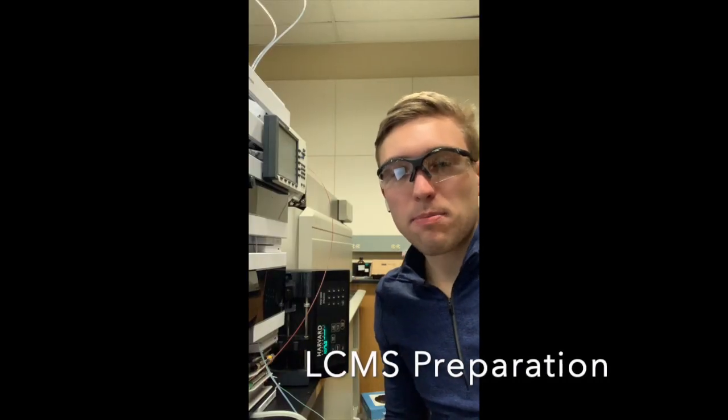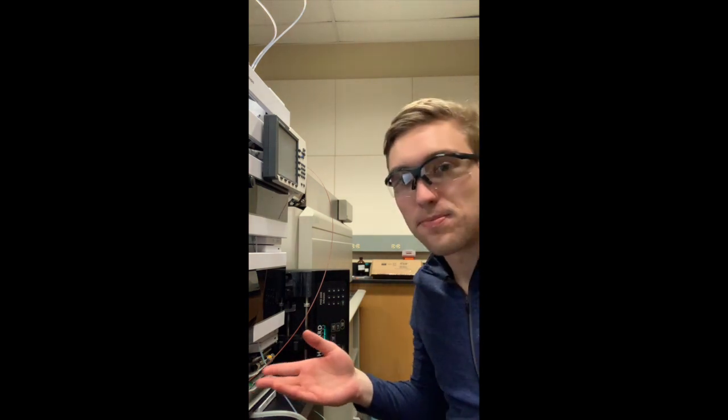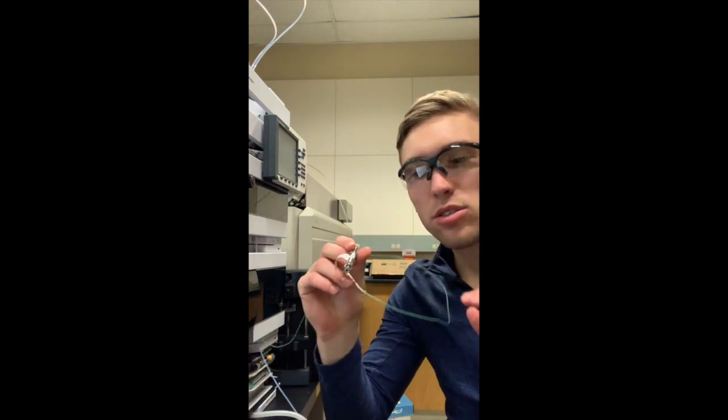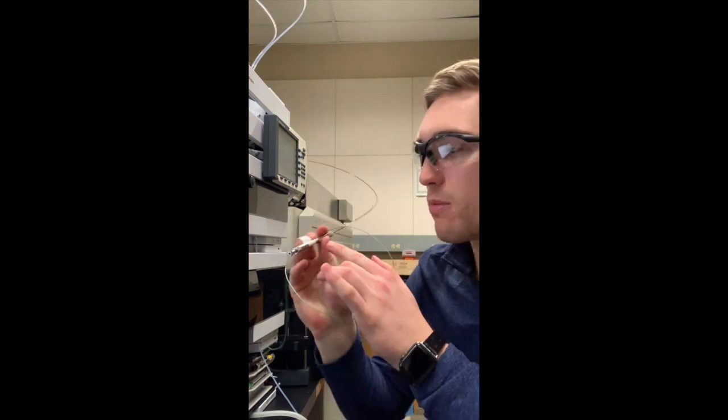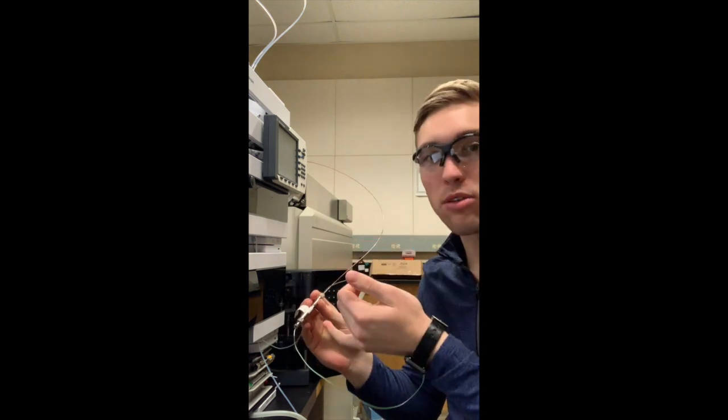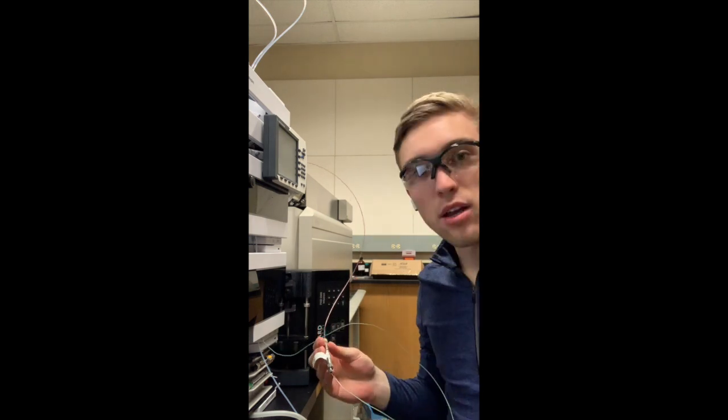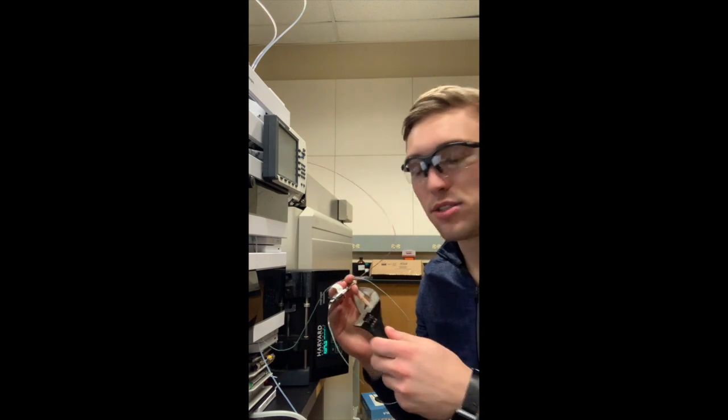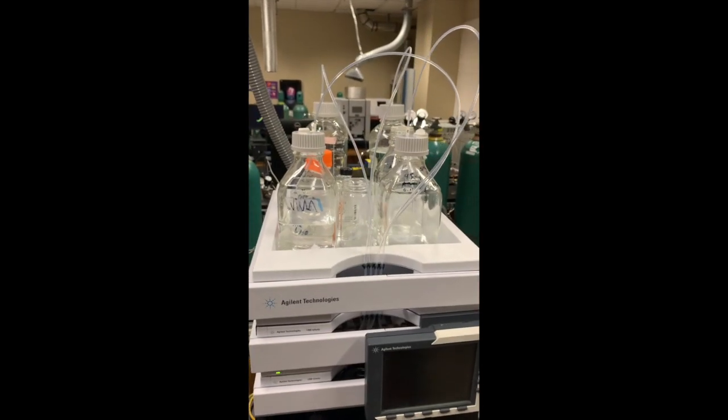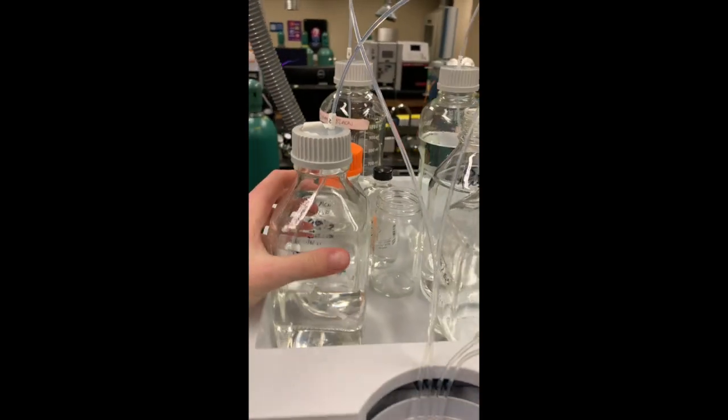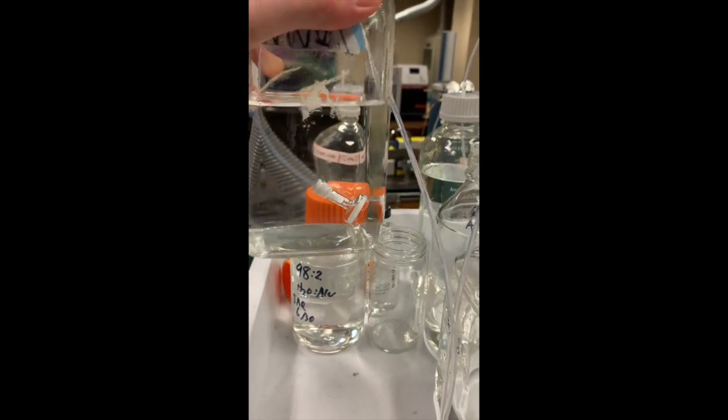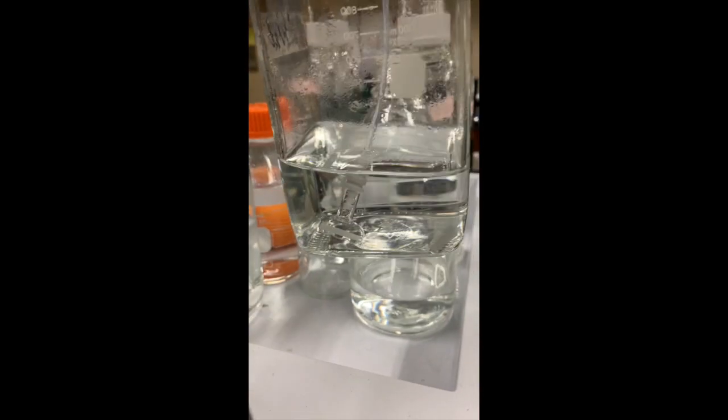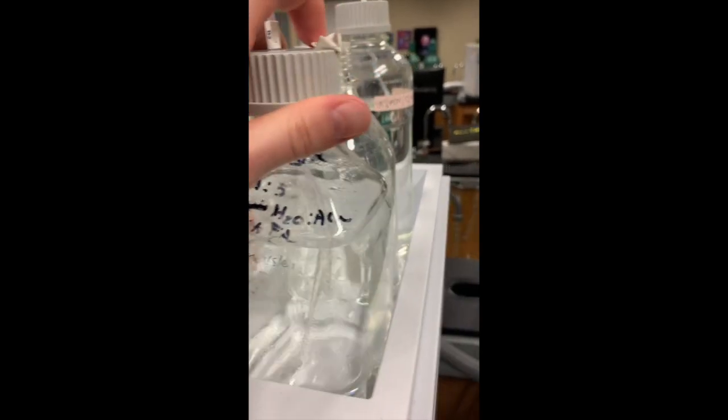The first step that you're going to take when coming into the lab and setting up your LC-MS is you're going to want to put on your column. So here I have a column set up, looks just like this and you'll notice there's an arrow on the column. You want to make sure that the arrow is pointing into the mass spec inlet. If you get this backwards that can seriously mess up your HPLC column and we have a couple wrenches. You'll have to use the wrenches to screw on the metal fitting onto your column here. The next step will be to check the bin pumps here to make sure that we have enough solvent in each of our bottles to cover the little frit here and it looks like we are good on that side and we're running a little bit low on this side but it's going to be okay for what we're running today.